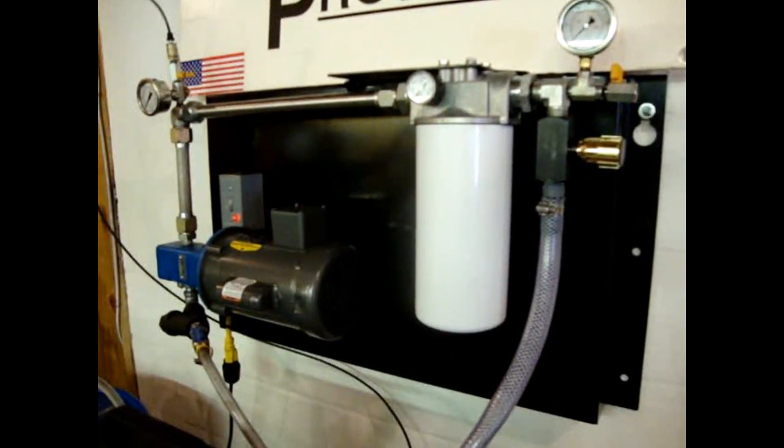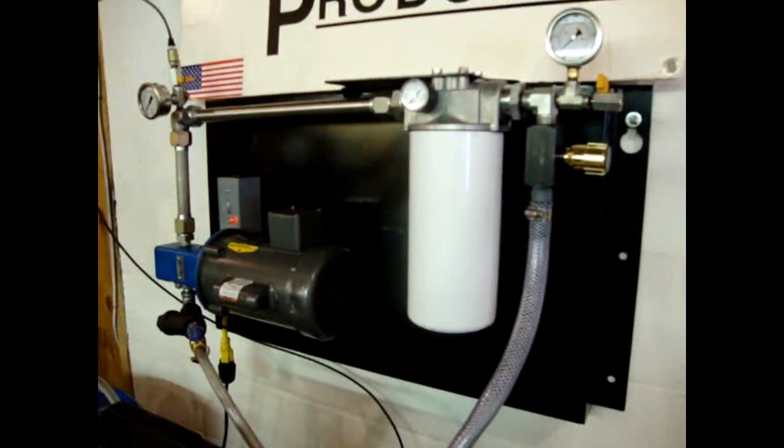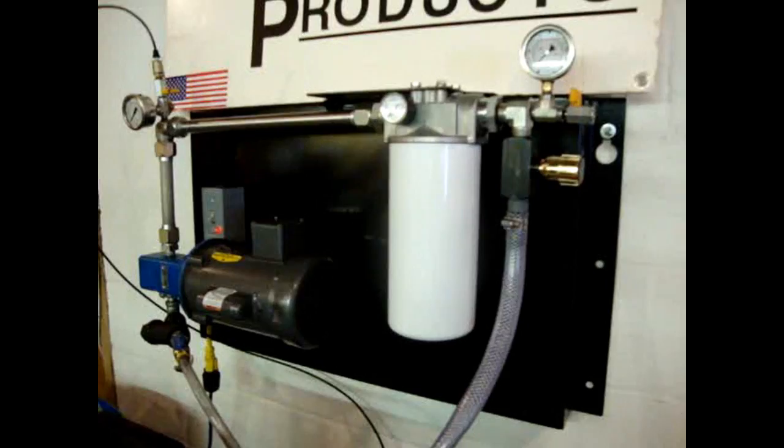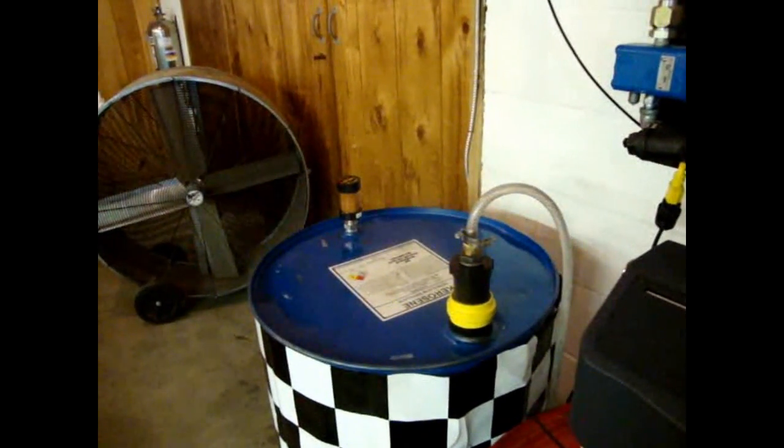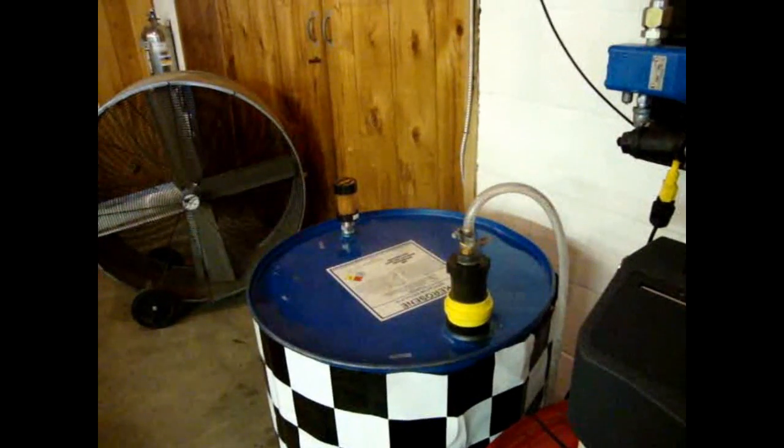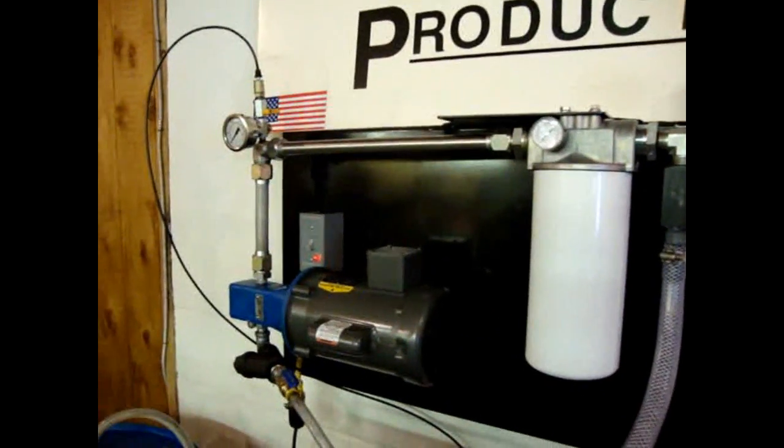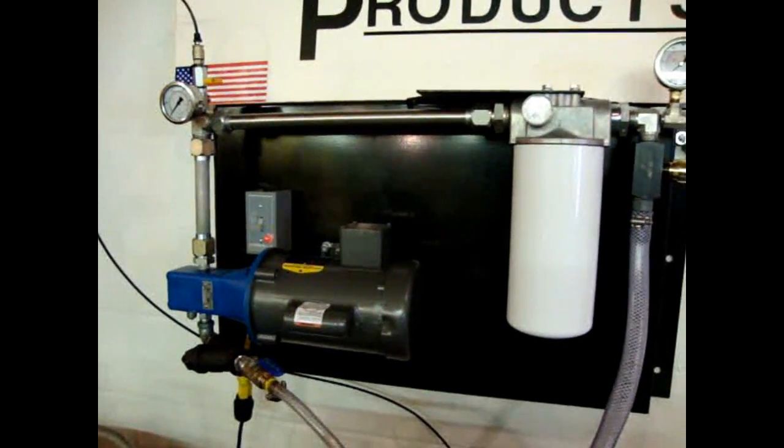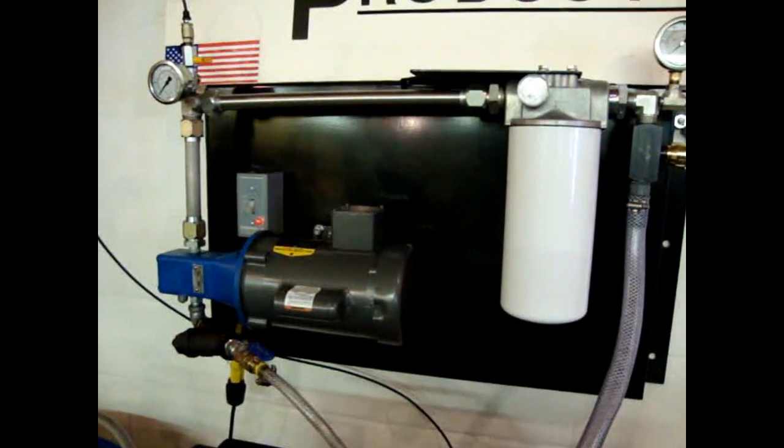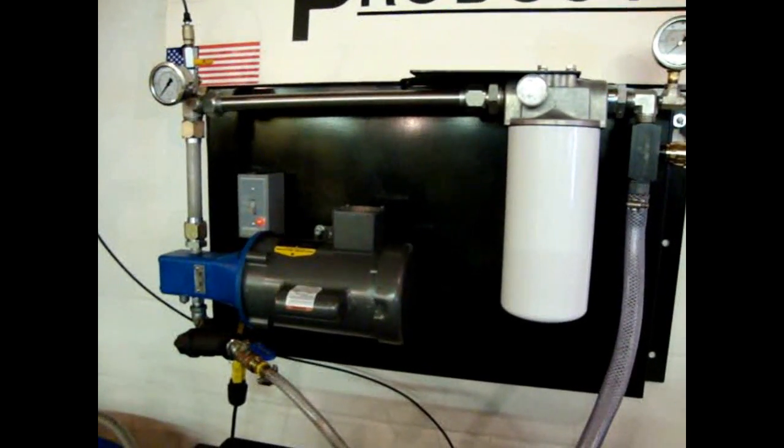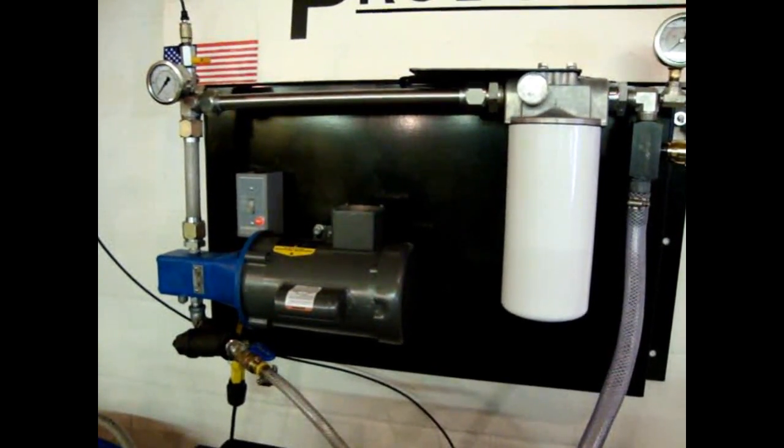Today we'll be utilizing a modified version of our SFP spin-on filter panel. We will be drawing the ultra-low sulfur diesel from this drum, which was provided to us by our customer, passing it through our filtration system, taking advantage of the test ports that we've put onto this rig, testing the quality of the fuel both before the filter and post-filter to come up with a benchmark.